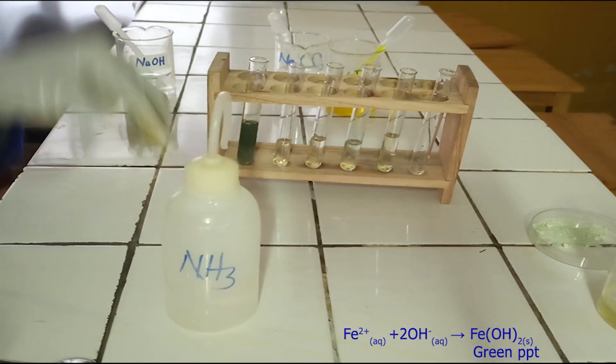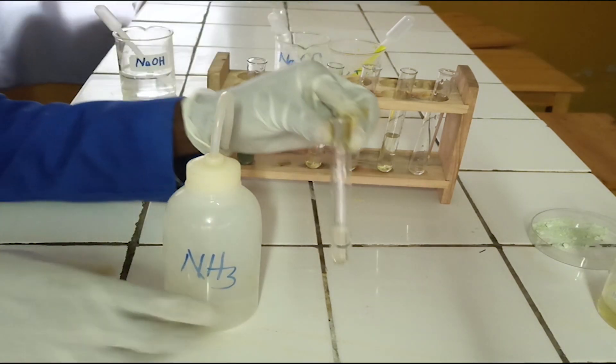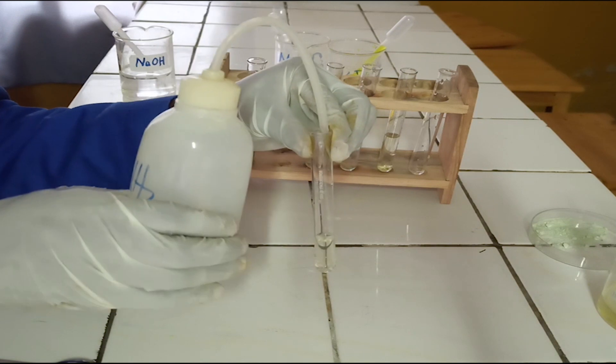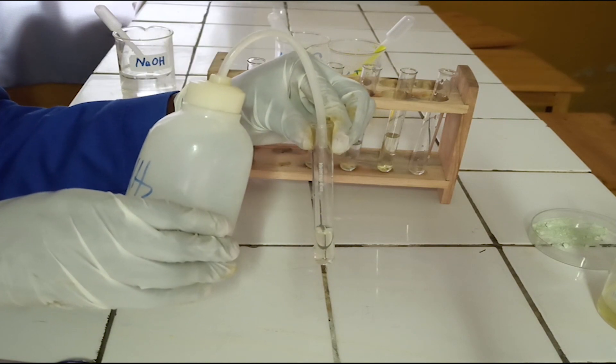To the second test tube, add ammonia solution dropwise until in excess.